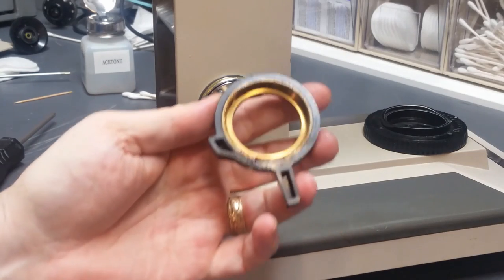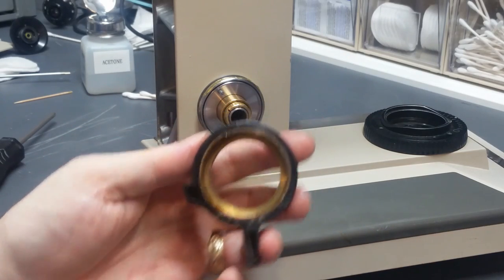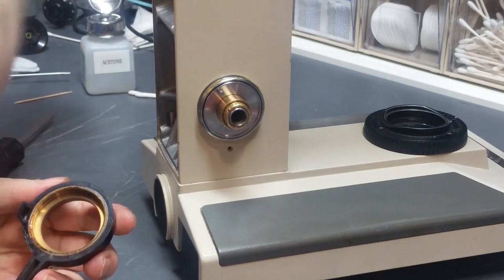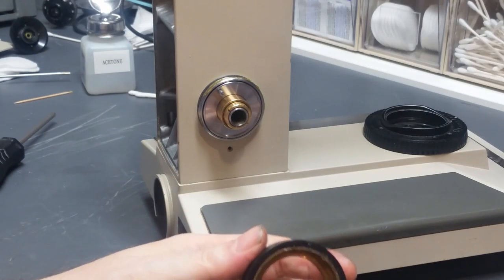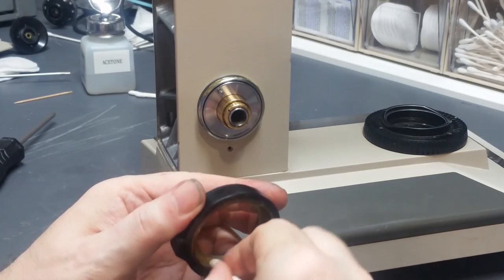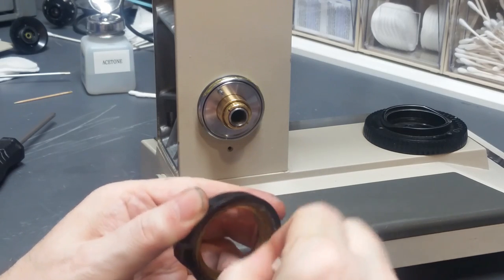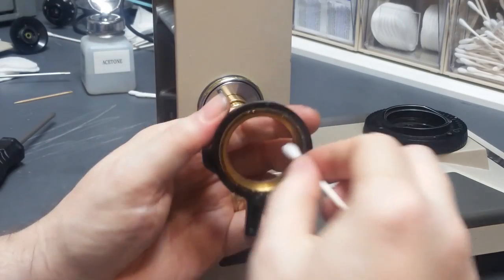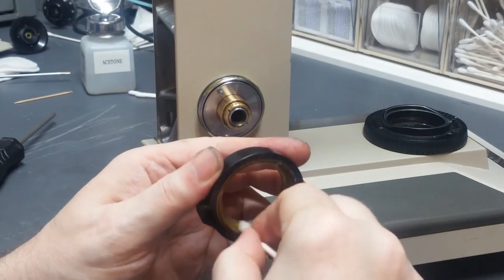What's next is this piece here. However, this piece is, as you can see, filthy. I'm going to hit it with acetone, being very careful to not get the acetone on the plastic, because it'll eat up this plastic knob. But as far as on the threads inside of here and on this brass insert, acetone should work fine.